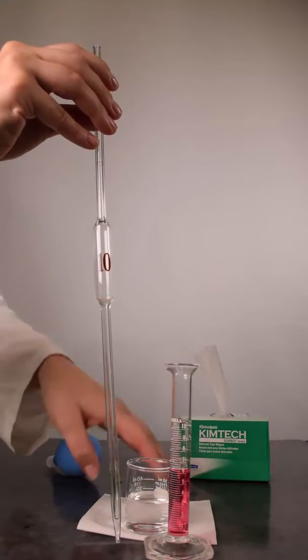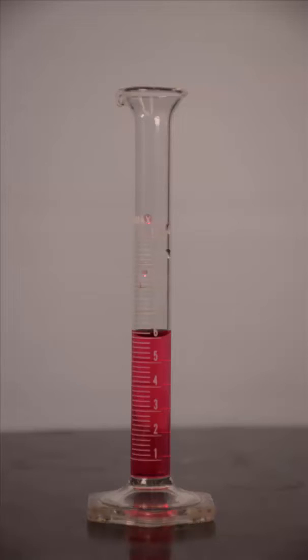As you can see, a 10 milliliter pipette can be completely rinsed with less than 10 milliliters of solution.